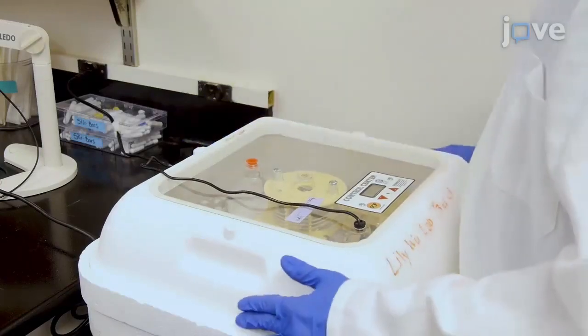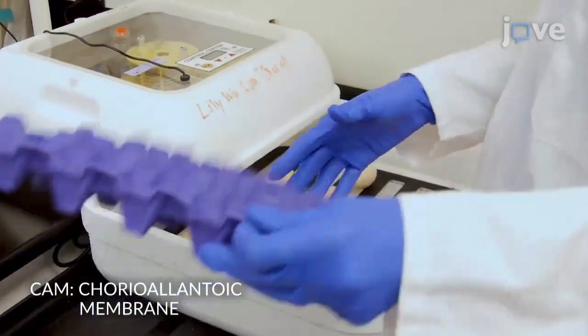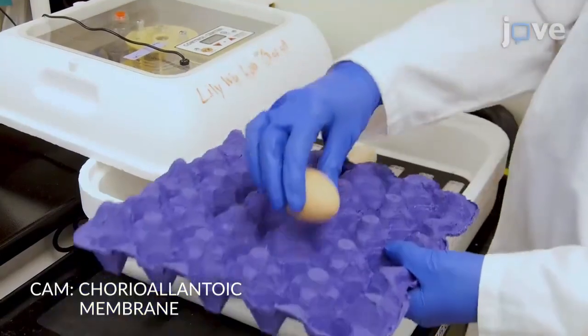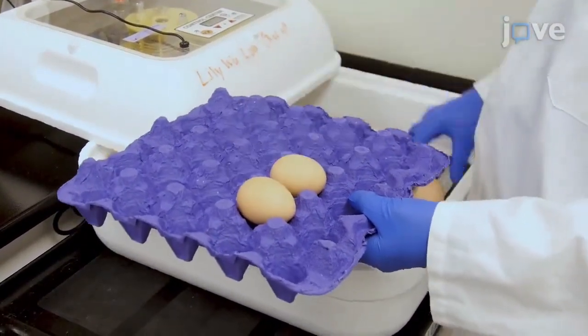On developmental day 7 or 8, when the CAM has fully developed, turn off the egg rotator and place approximately 1 to 3 eggs into the egg rack in the biosafety cabinet.